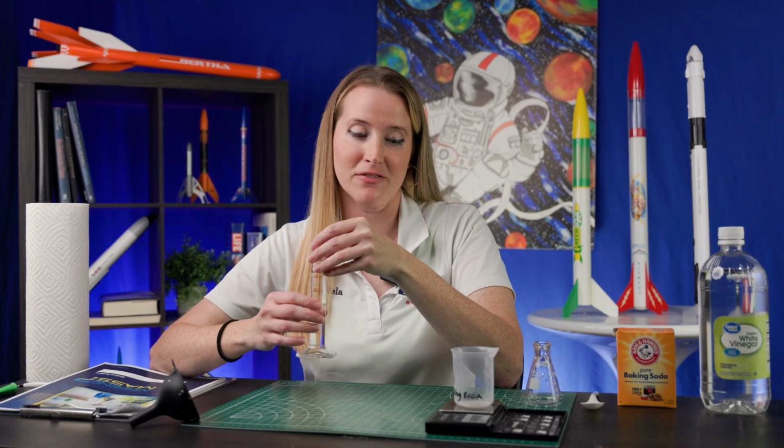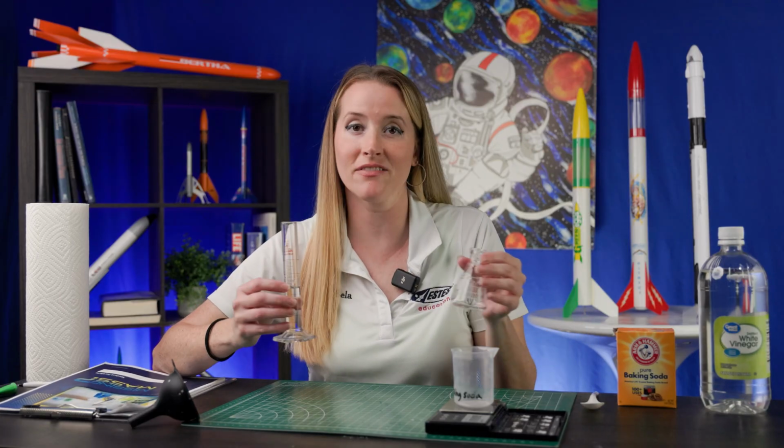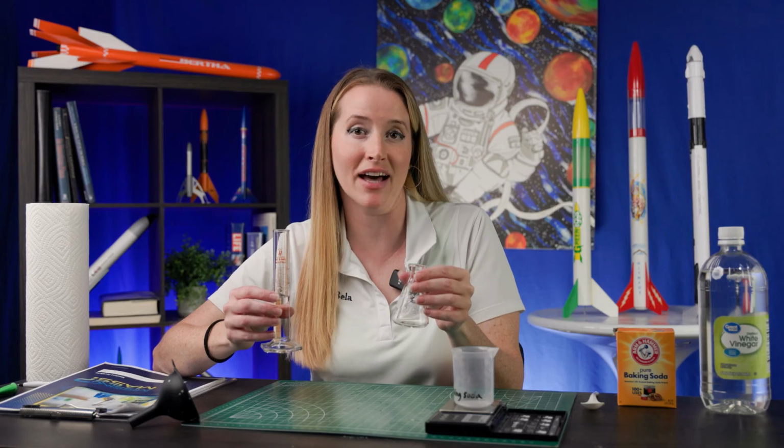Now let's do an experiment. Feel free to grab your own supplies and do the experiment right alongside me. I have here vinegar and baking soda. You're going to use your graduated cylinder to measure 15 milliliters of vinegar into your Erlenmeyer flask.